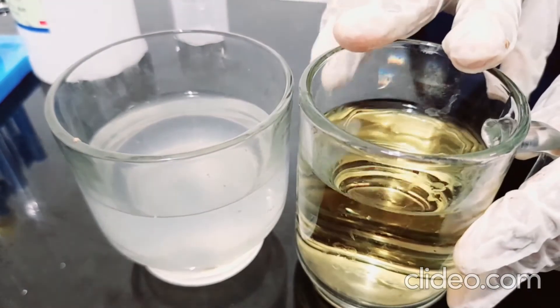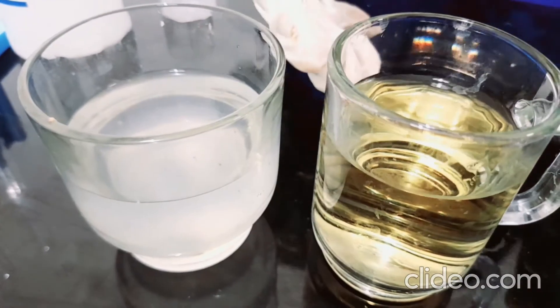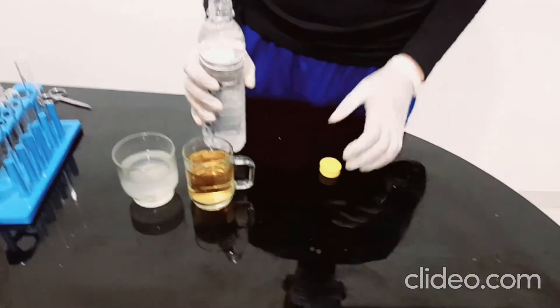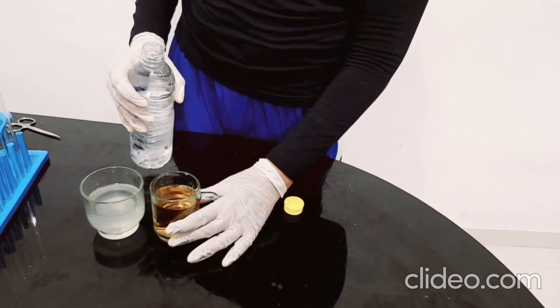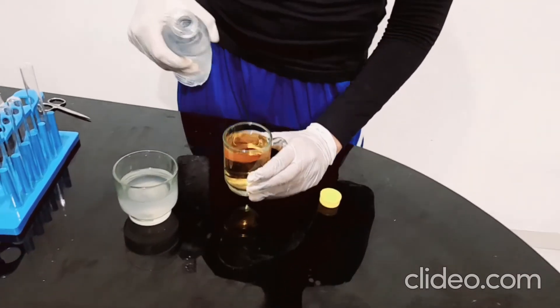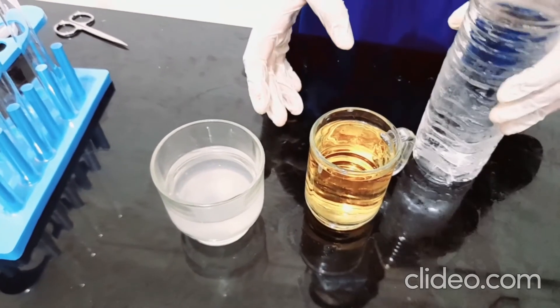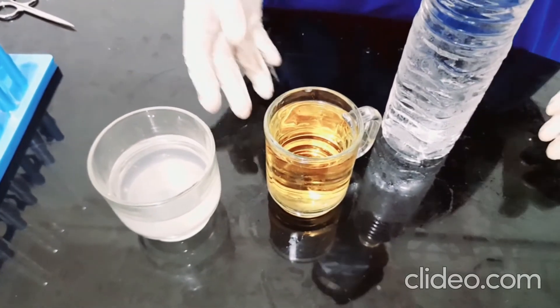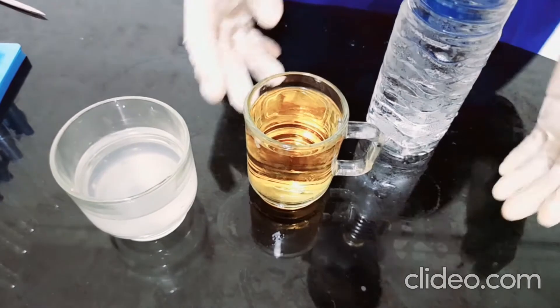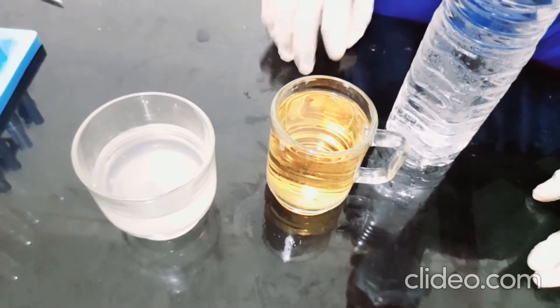I'm going to try to bring back the color of the iodine solution to its original color by adding a bit of vinegar. Vinegar contains acetic acid, which is going to undo the process done by the H2O2. I've just opened the vinegar — when I pour it in the chemical reaction shall begin. It contains acetic acid that will react with the iodine and H2O2 in it. It may take up to five minutes. When we add vinegar — acetic acid — to it, it's a different type of clock reaction, but it's going to turn transparent right back to dark orange.